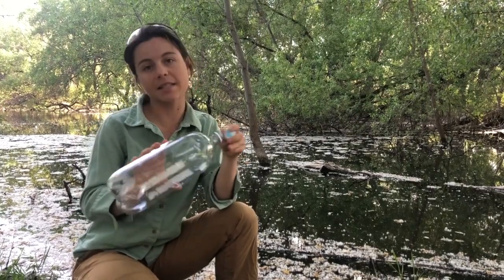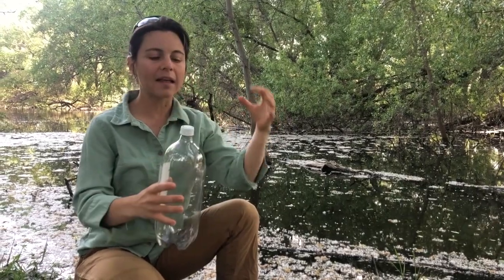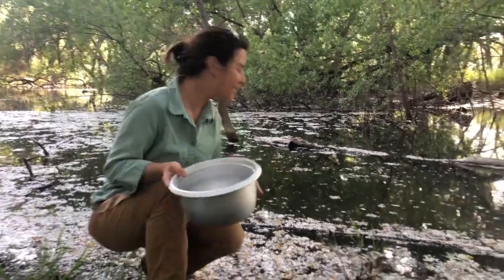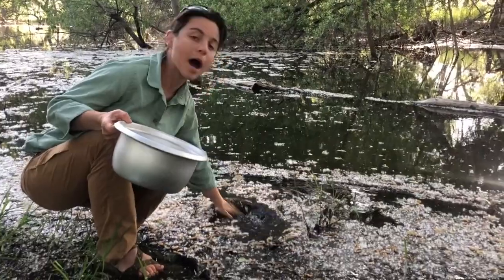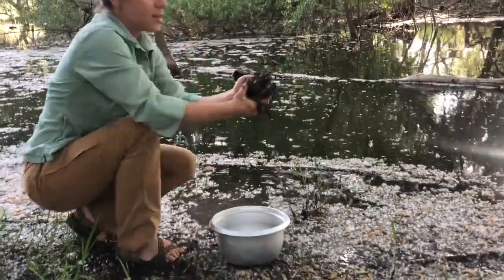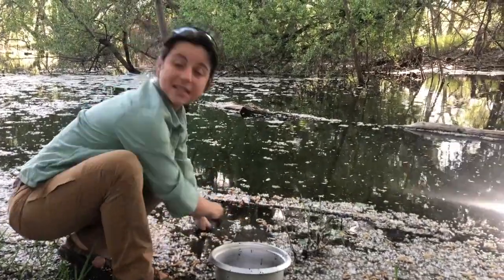For this experiment, you're gonna need a sealable container. In this case, a 2-liter bottle. We need it to be sealable because we don't want anything to be able to get in or out. We want to create a closed system where everything cycles within the bottle. You're also going to need a mud and soil sample. So this is the funnest part. I'm going to move away some of this top layer, including a lot of the leaves. And then I'm going to start to scoop out some of this really thick mud and put it in my container here.